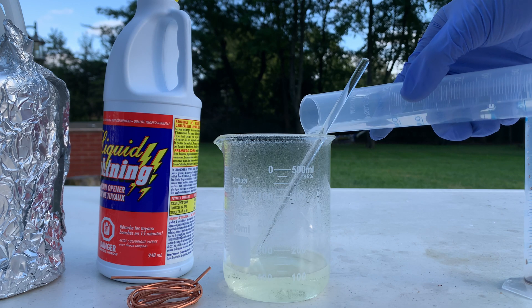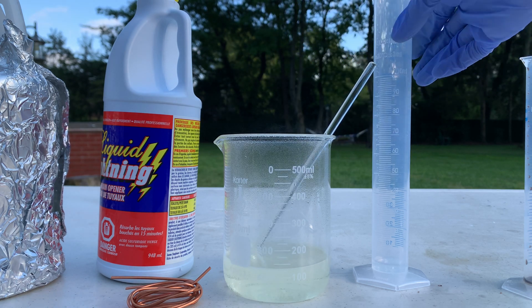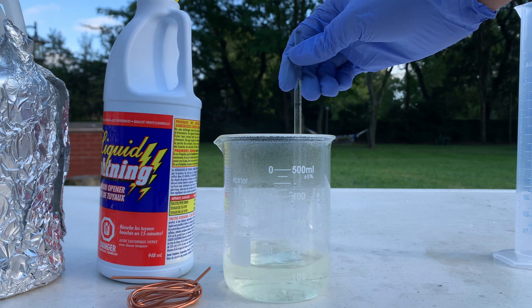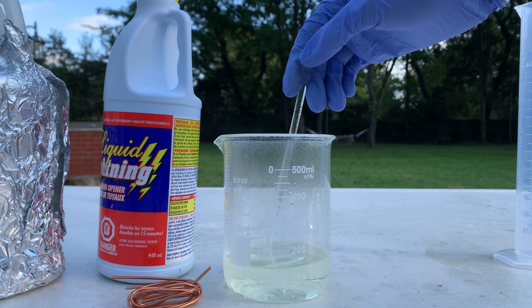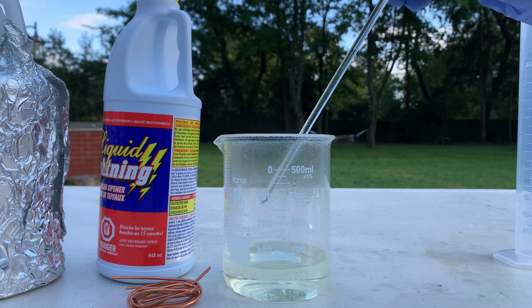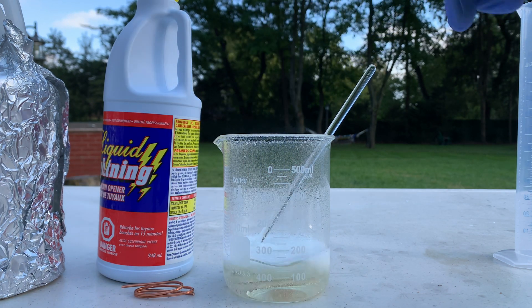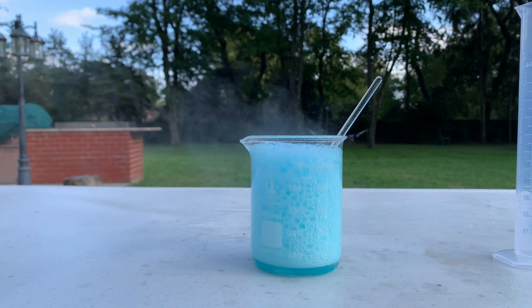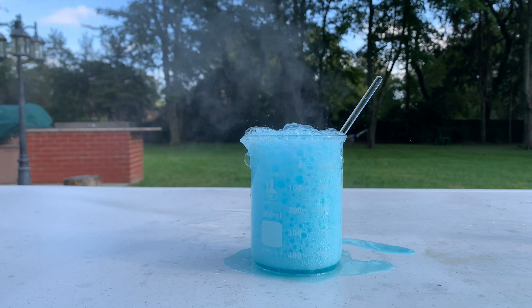All right, and the last bit. That's all the hydrogen peroxide and sulfuric acid added to the solution. It's a yellowish solution, which shows that it's pretty concentrated sulfuric acid. This has heated up a decent amount — oh my god, that's really hot. Now I'm going to drop in around 30 grams of copper metal. Hopefully this doesn't overspill — it is, hopefully not too much.